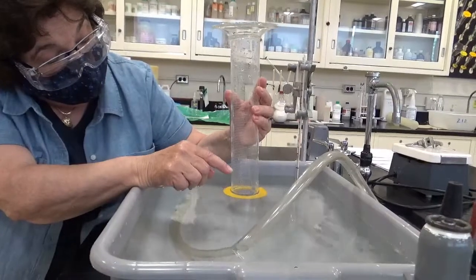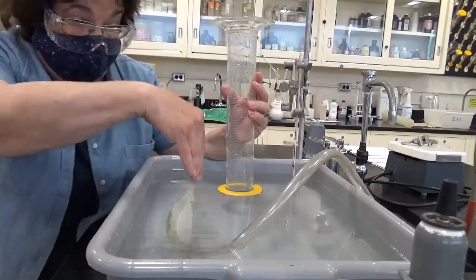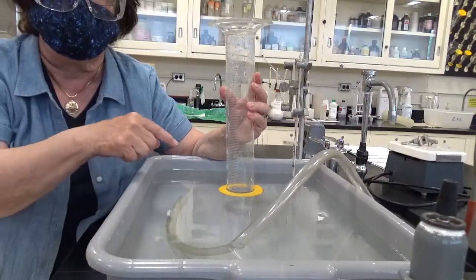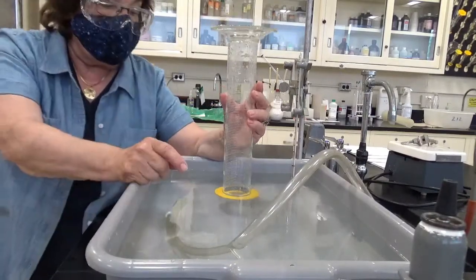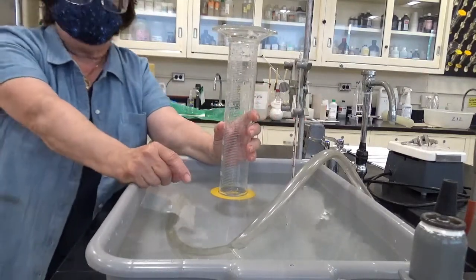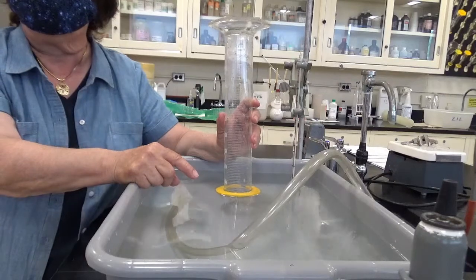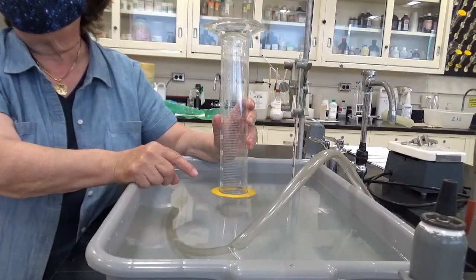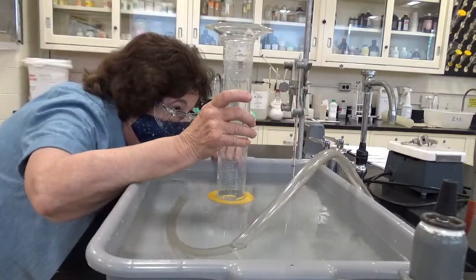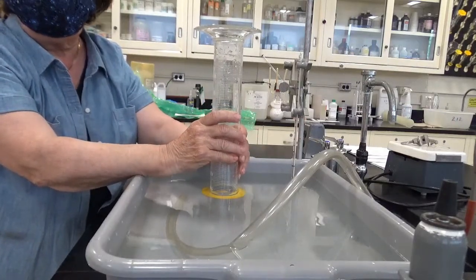So when I make these two levels exactly equal, the pressure inside of the gas and the pressure outside of the atmosphere are equal. And that's what I have to do in order to measure the pressure of the gas inside the cylinder. So I have the volume now. Now I have no decimal places because I can't measure that well with this instrument. 475 milliliters. And the temperature? 20.1 degrees C. And we'll put the mass on from our data table a little later.